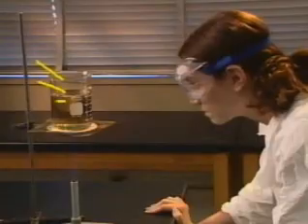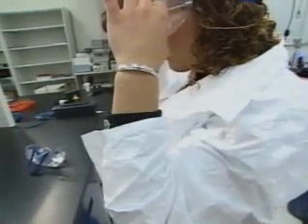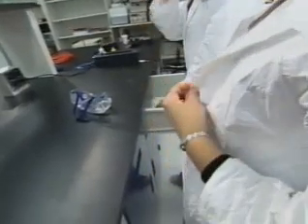They might look silly, but they protect you. Don't wear your goggles, and if this beaker explodes, you could go blind. Lab coats or aprons as well. They protect you and your clothes. Boy, remember that kid back in 79? I don't even like to think about it.